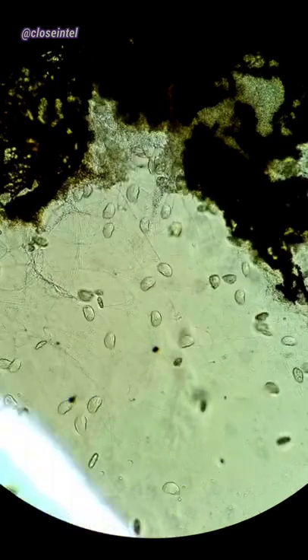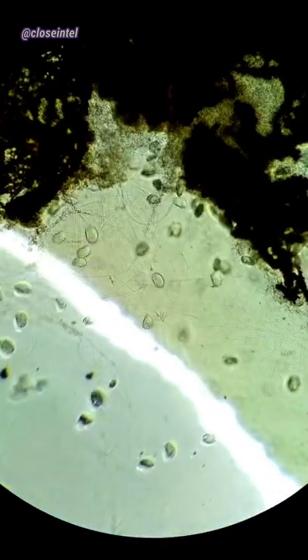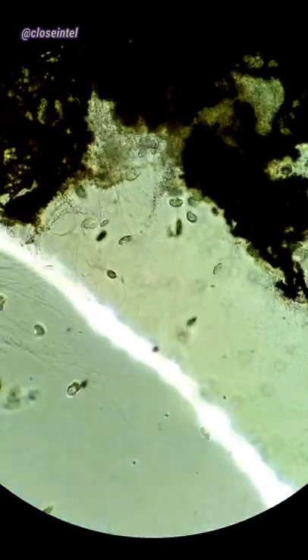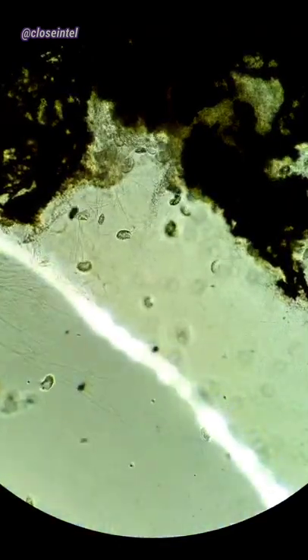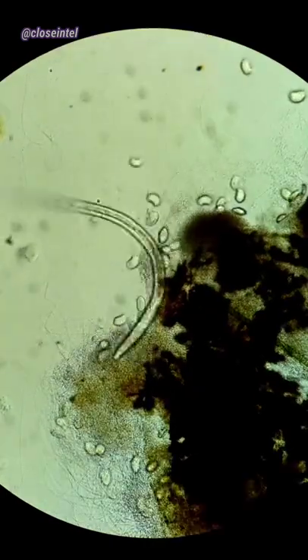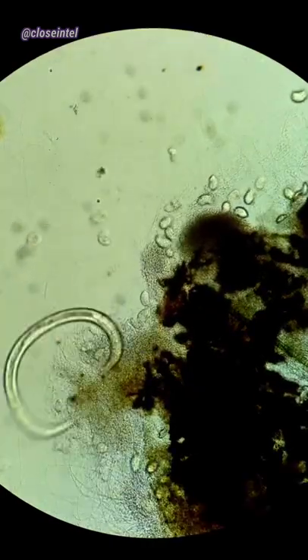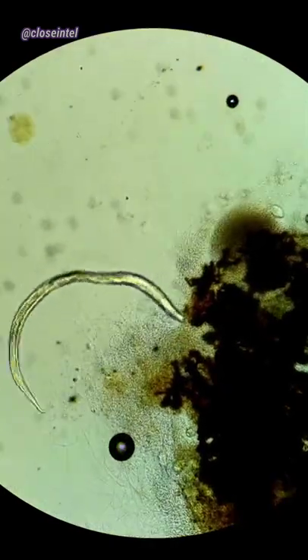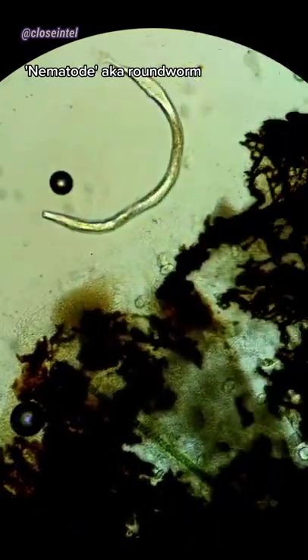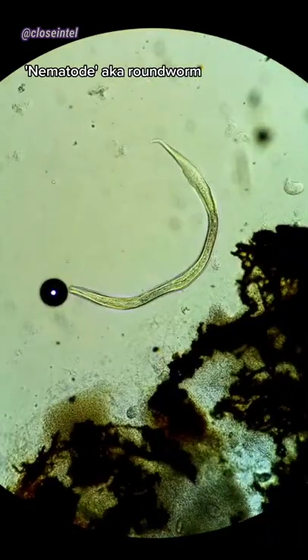You can see when I add a drop of the chlorine here, and as soon as it touches the cells, you can see that they all stop moving immediately. Just on the other side of the slide, it only took a few seconds for the chlorine to also reach this nematode and the other cells.